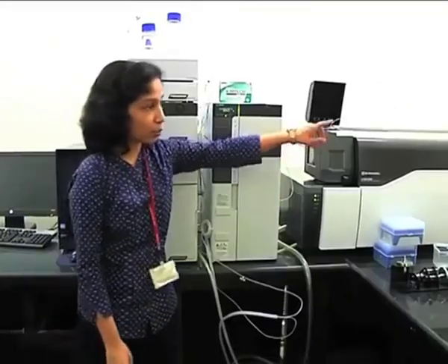The detector is your electron multiplier. Here, one more thing, one special feature of this collision cell is that it has a UF sweeper, which has already been explained, right? Like I explained the carryover effect, the same carryover effect can come in your mass spec as well. Suppose I am monitoring one particular transition.